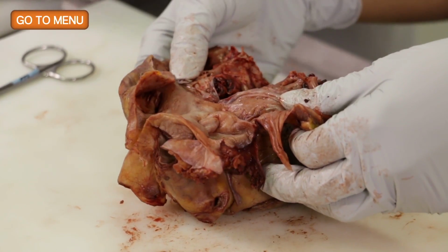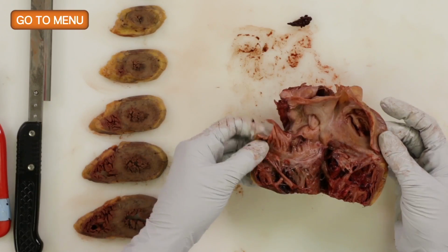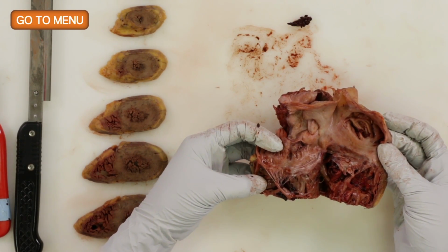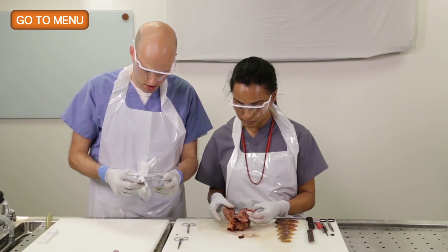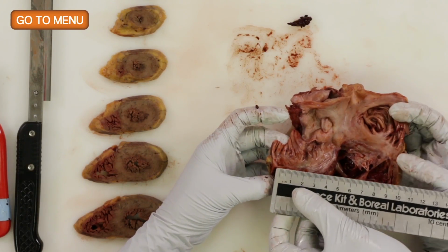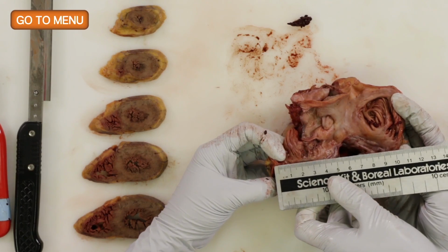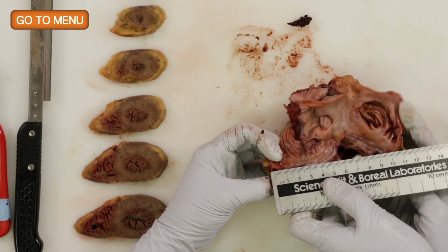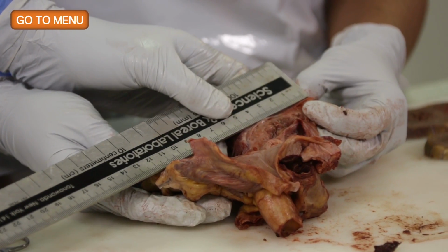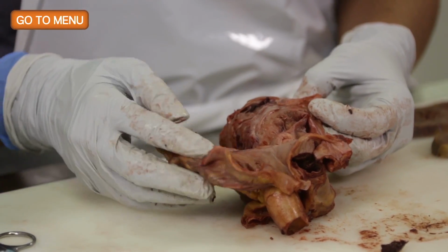You can see the papillary muscles, some of the chordae tendineae, and would you say the papillary muscles look intact? Pretty much intact. So we get a measurement here. And it's helpful if this would bend, but we're going to estimate at about 12 centimeters.